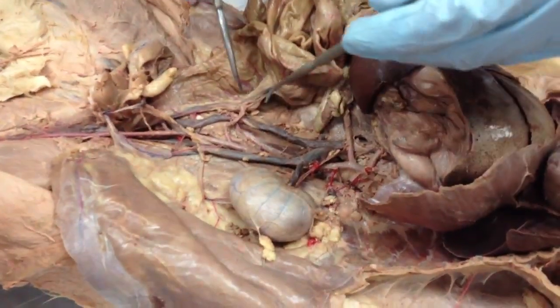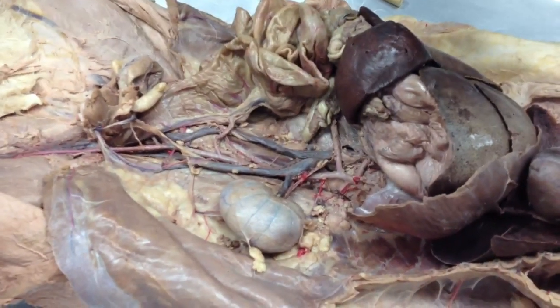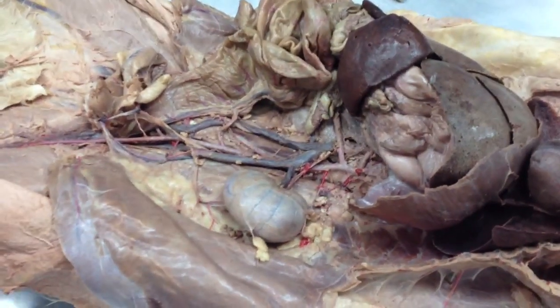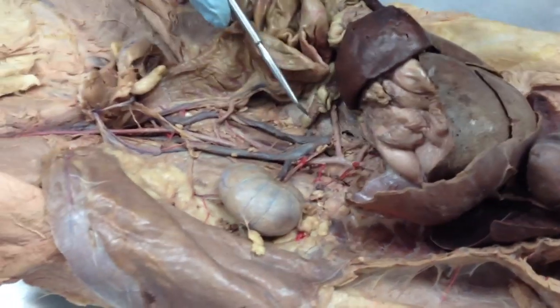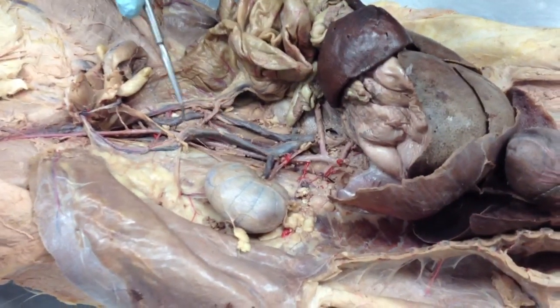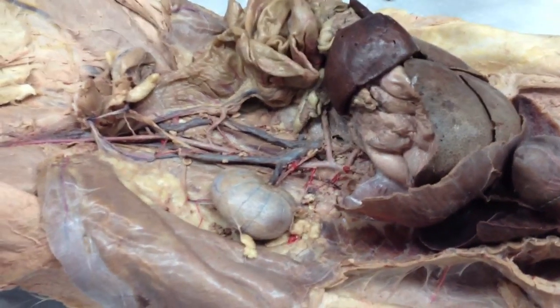If I have this cat out and you see a large vein in the abdominal area that's branched out like that, and you see a pin in either one, I'll accept inferior vena cava for either one, because as far as I understand, that's what it is. But like I said, on every other cat, it's probably just going to be one inferior vena cava running down there. And it should be parallel to the abdominal aorta right there. Does that make sense? Mm-hmm. All right.